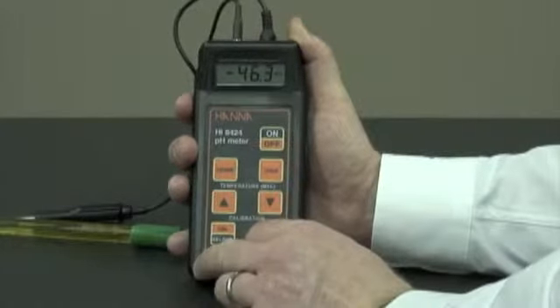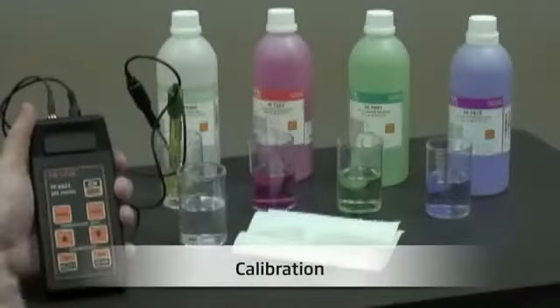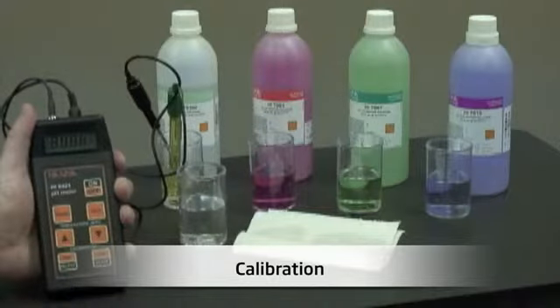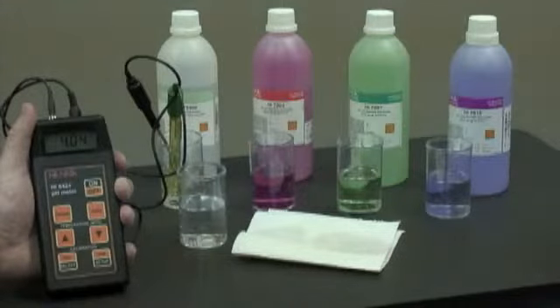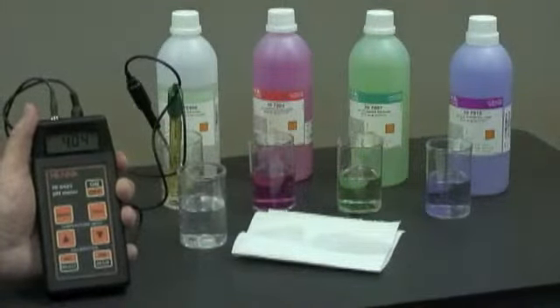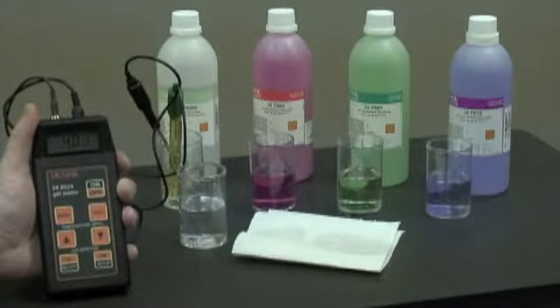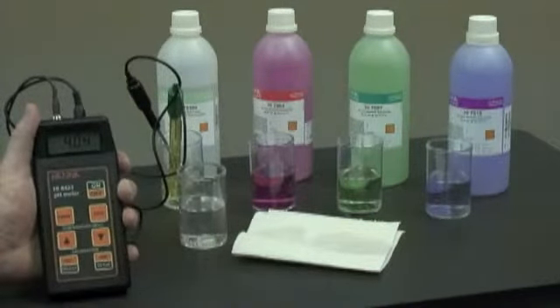Now I'll show you how to calibrate the pH probe. Now we'll turn on the unit. As this is a new pH electrode, we need to condition it. We'll use HI70300 storage solution. We need to do this for up to two hours. If we don't have any storage solution on hand, we can use any one of our buffers.